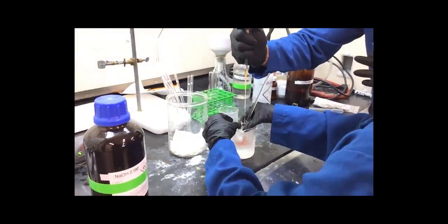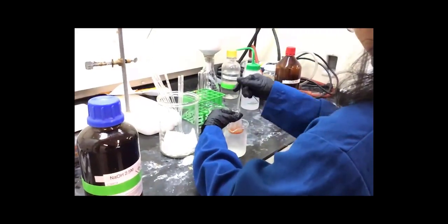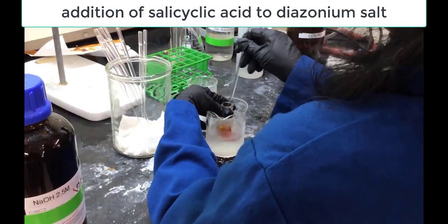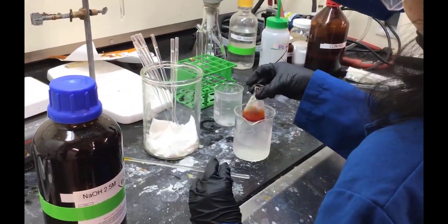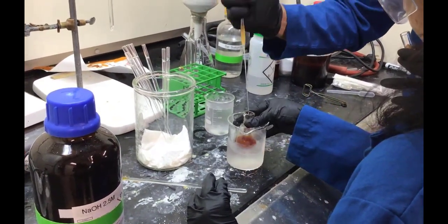And so what you see in this long Pasteur pipette, they're adding the salicylic acid to the diazonium salt solution. And they're also keeping it chilled while they do the addition, adding the two solutions together.